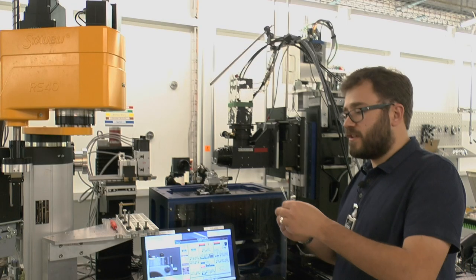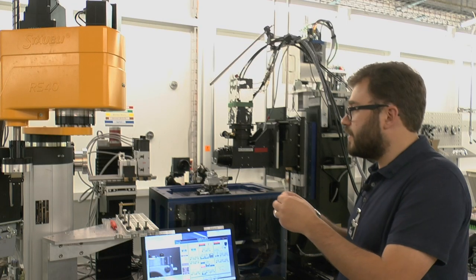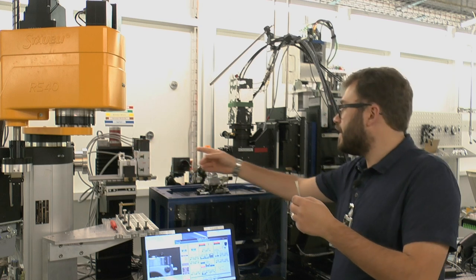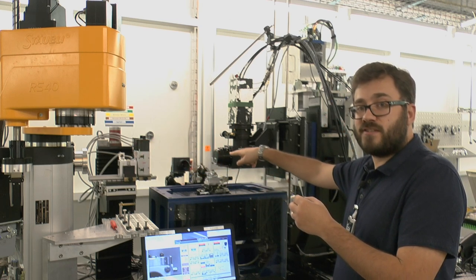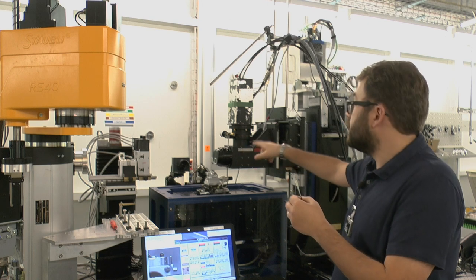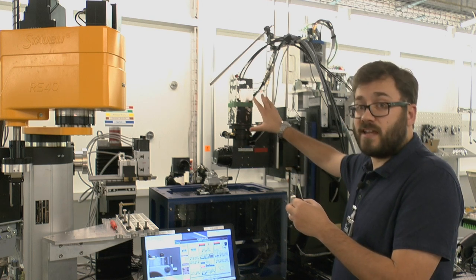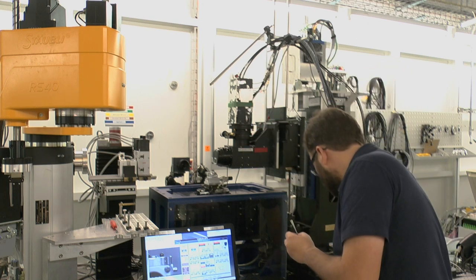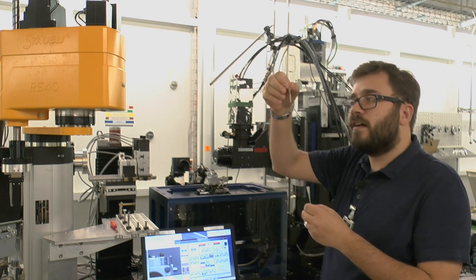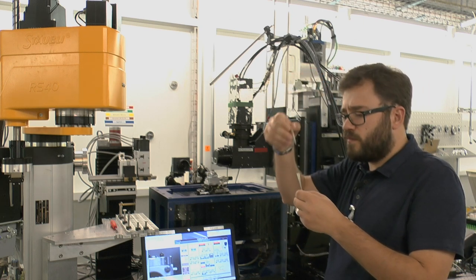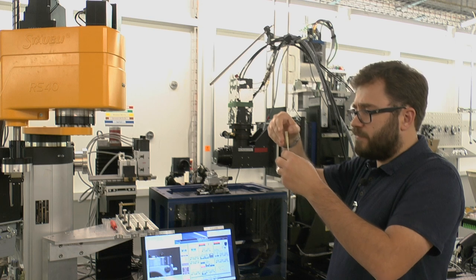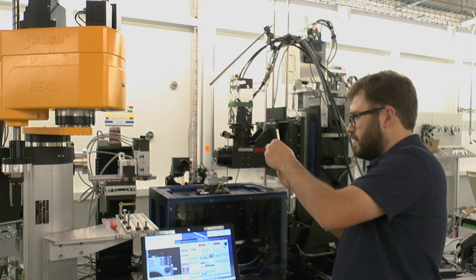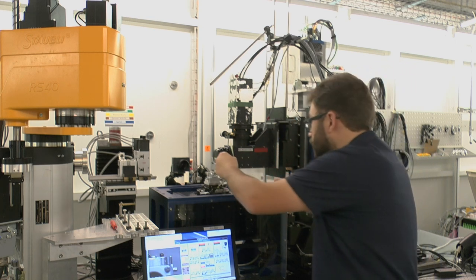So I'm just going to mount the specimen in the beam. This is where the x-rays come down and they get collected here on a scintillator that turns the x-rays into visible light. Then they get collected by a regular camera. So I've got my little lamprey tooth here in a little tube. I'm just going to mount it in this sample holder and then place it on the stage.